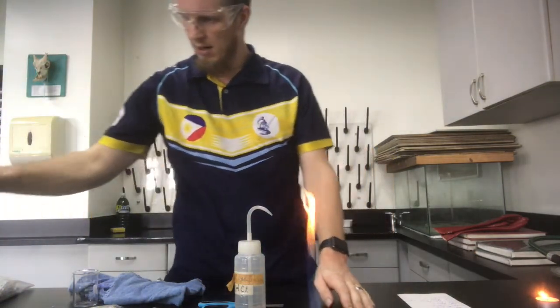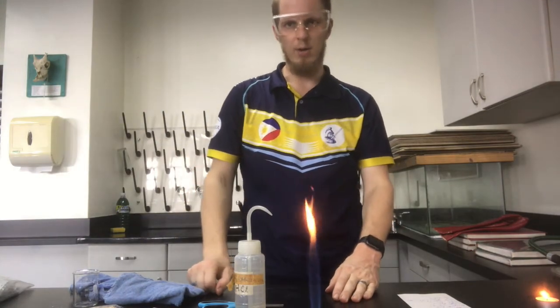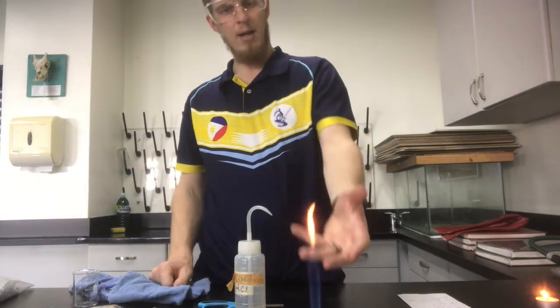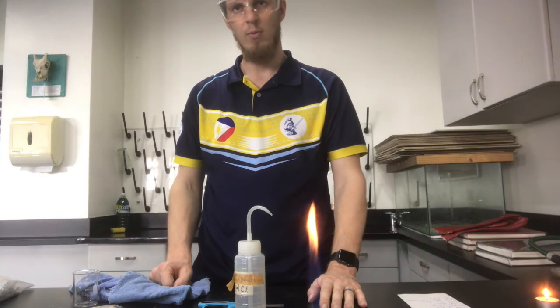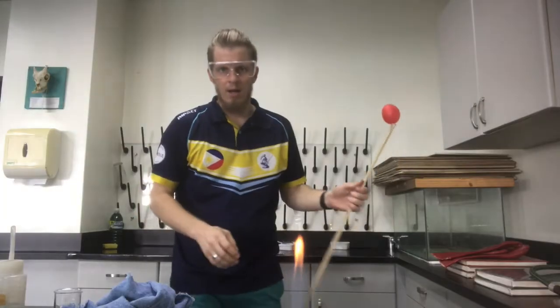Alright, I'm going to pause this video here and try to get a good combustion reaction, but if I don't, you've got one going on in front of you pretty much the whole time of this video, where I'm burning natural gas and producing water and carbon dioxide. Alright, a few moments later.